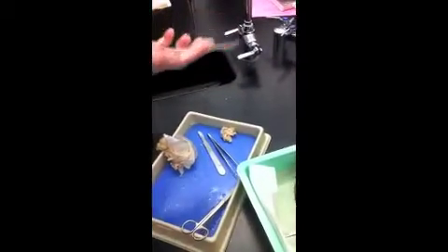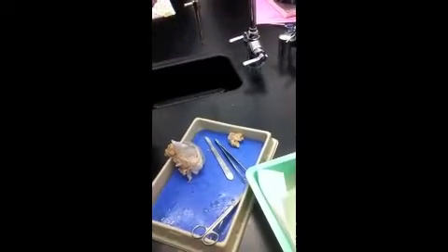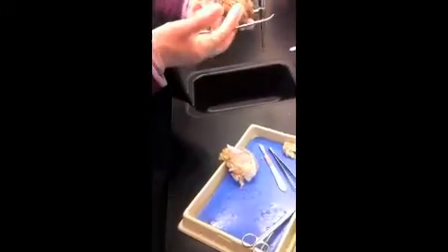The pineal gland is what I'm trying to show you. On yours, you'll be able to see it better because, like I said, you can just make a dissection, a cut right down there. Which gland is it? Pineal. It produces the hormone melatonin, which is important for sleep-wake cycles.